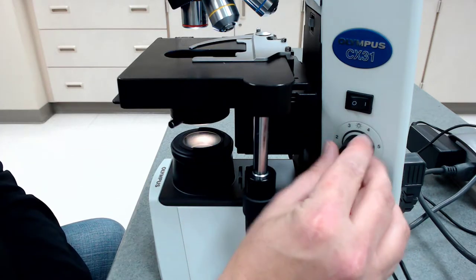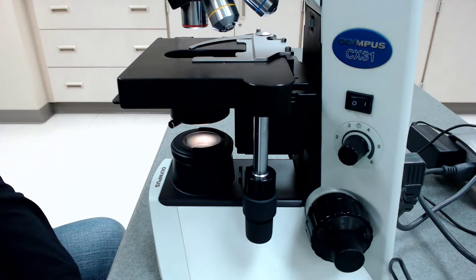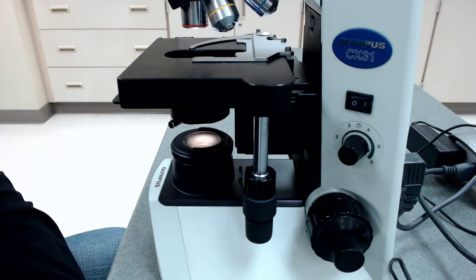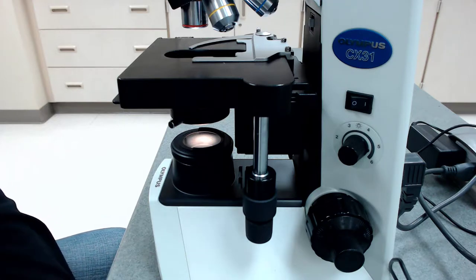So generally speaking, I recommend using just as much light as you need. Too much light can lead to eye strain and headaches. Especially when you're first getting used to using microscopes, I actually like them pretty bright. But if you don't, just use just enough light to get the job done.